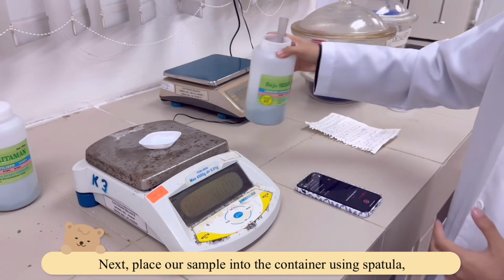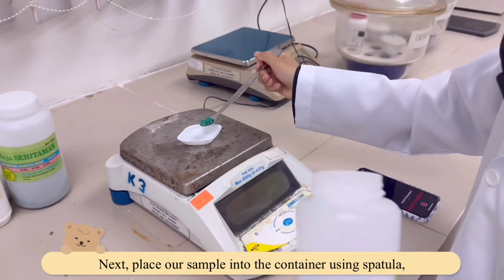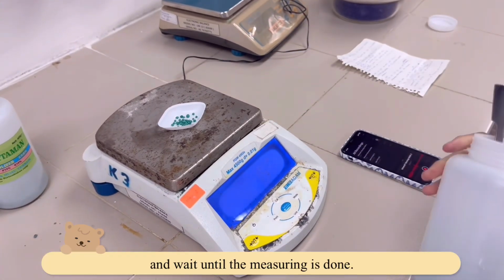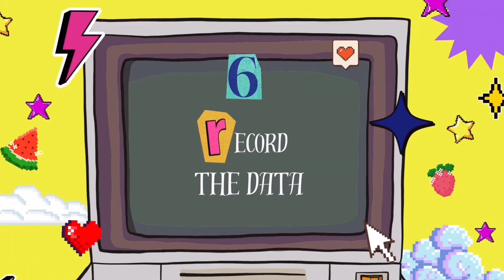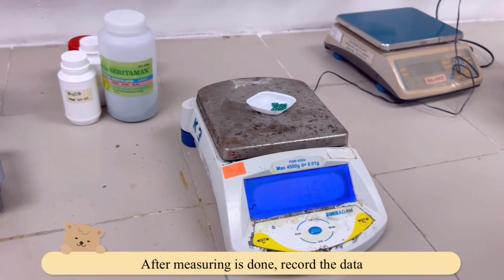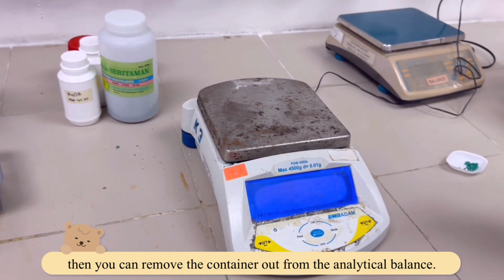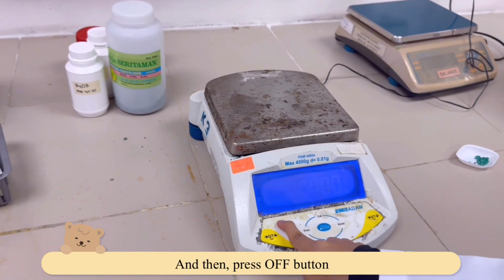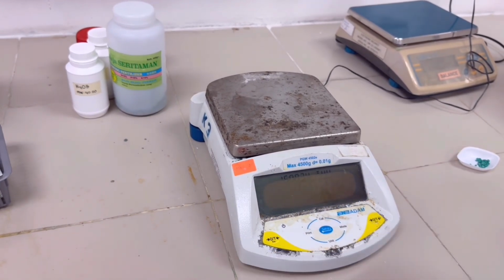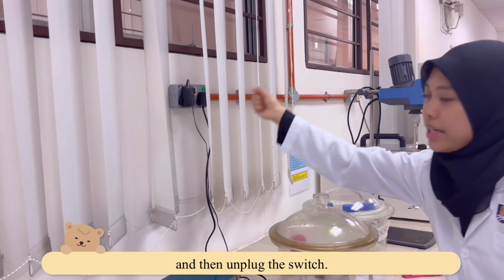Next, place our sample into the container using a spatula and wait until the measuring is done. After measuring is done, record the data, then you can remove the container from the analytical balance and then press the off button and wait until the light is off. Note this, don't forget to switch off the button and then unplug the switch.